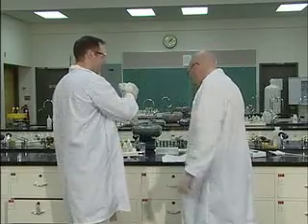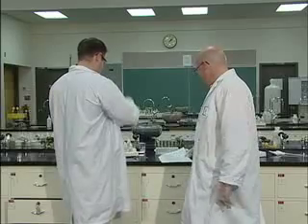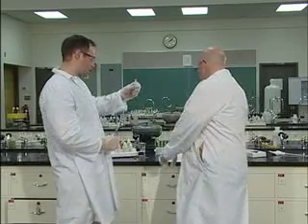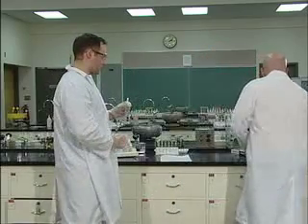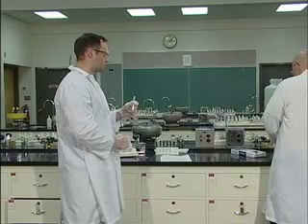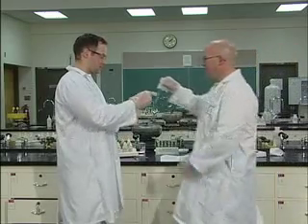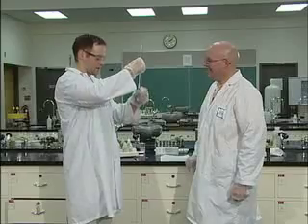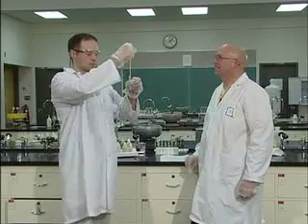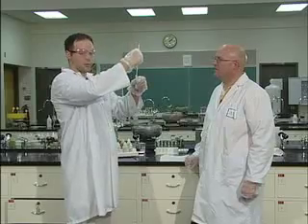So again, we have our sodium carbonate, 30 drops of sodium carbonate. We're going to measure again the initial temperature of this one more time. So we have a clean, dry thermometer. I didn't really clean it that well. Just a second. Perfectly clean. Time-lapse photography, obviously. And again, we're going to notice this is probably right on 25 degrees or thereabouts.